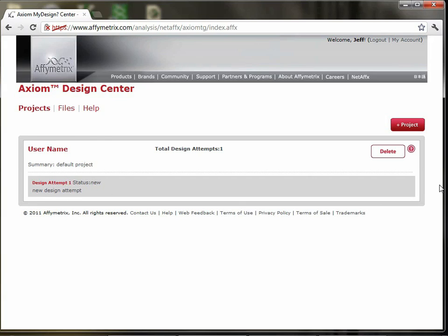Here is the actual first project. It comes by default. You can see that it's named, in this case, username, which is where your username will be. So let's navigate to that. If you want to make an additional project, you use the plus project button over here. So if you click on the name, it'll take you to the project.